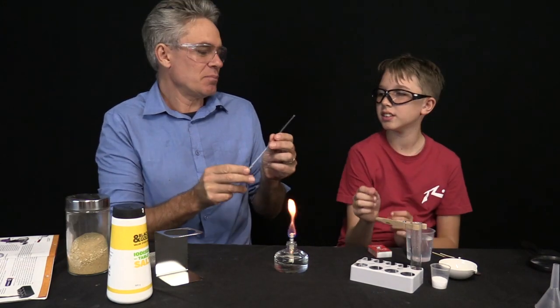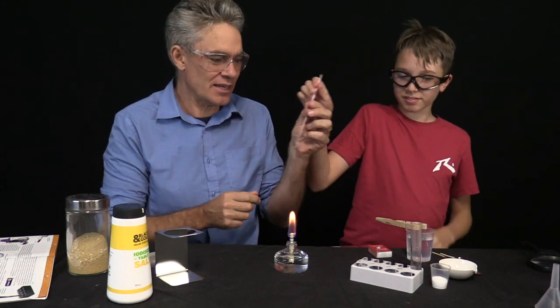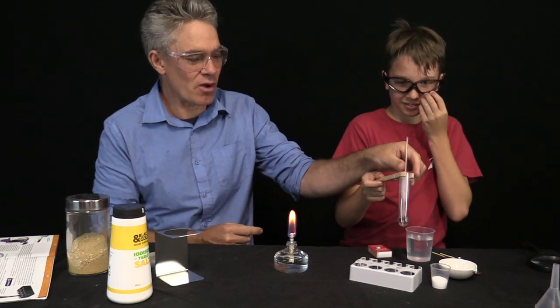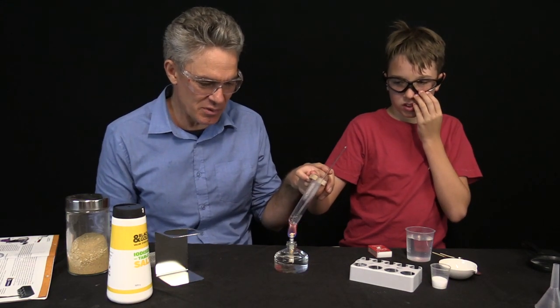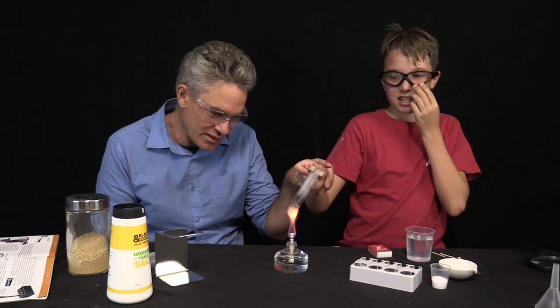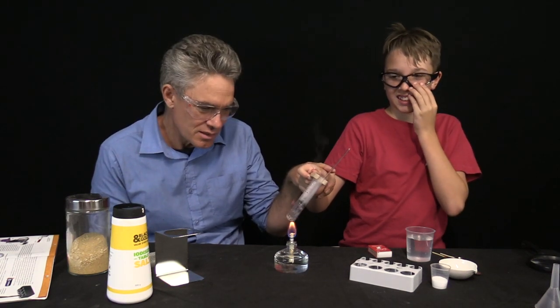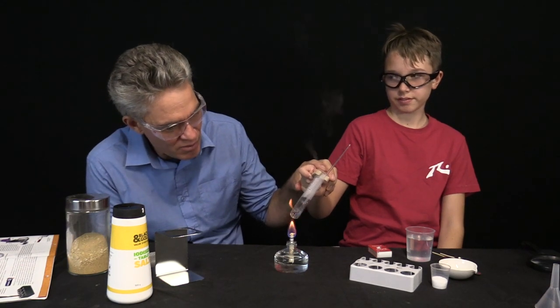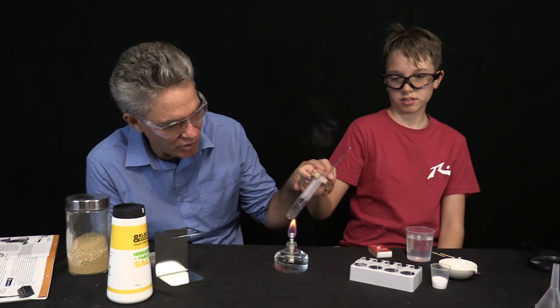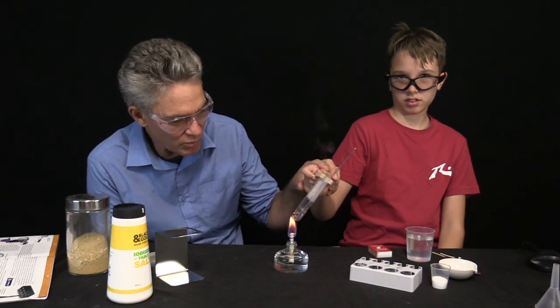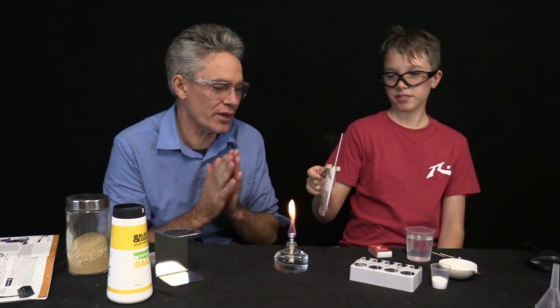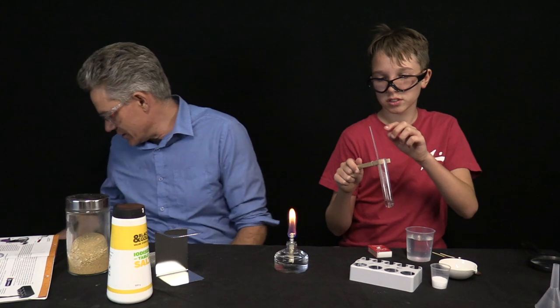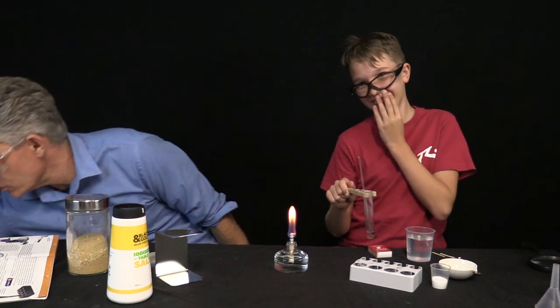Experiment number two is to actually put the boiling rod and see what effect that has. Put the open end down. Put the boiling rod in and see what effect that has when you heat it up. So this is experiment number two. Does that have much of effect? Yeah, making it go faster. Makes it go faster. Well, it was already hot, so it will go a bit faster. But I think it actually stops the bigger bubbles from forming. Yes, I think the boiling rod actually does help heat more uniformly.